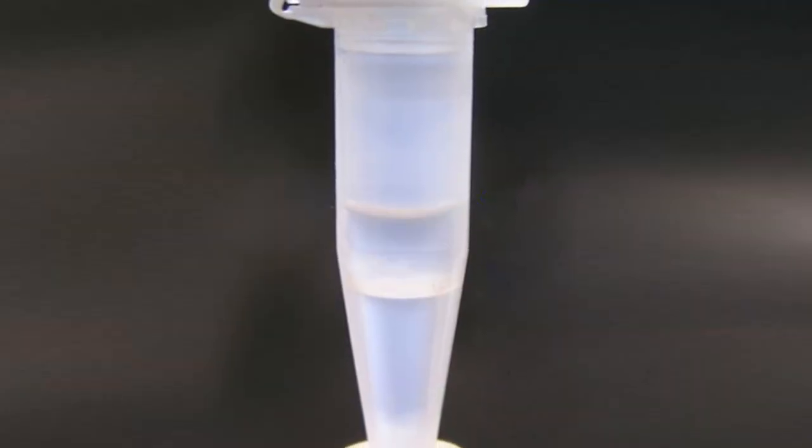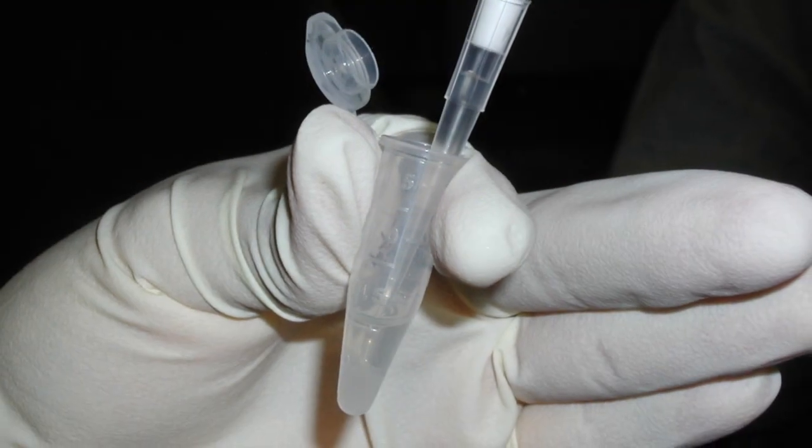Now, the contents of the tube are separated into two layers. Transfer the supernatant to the new vial.